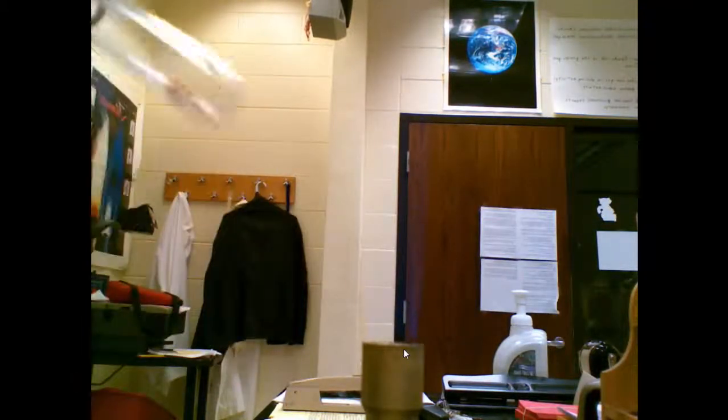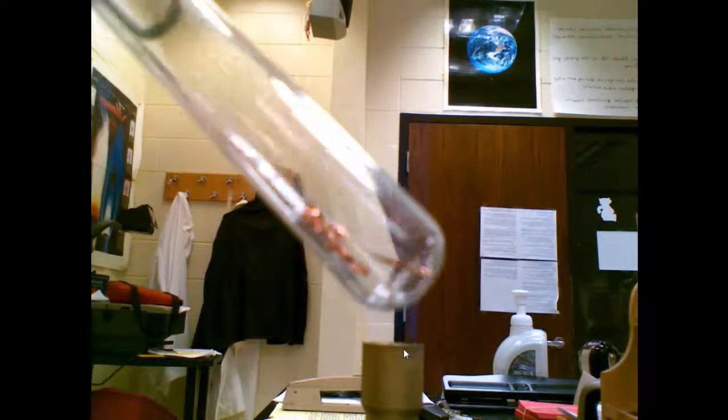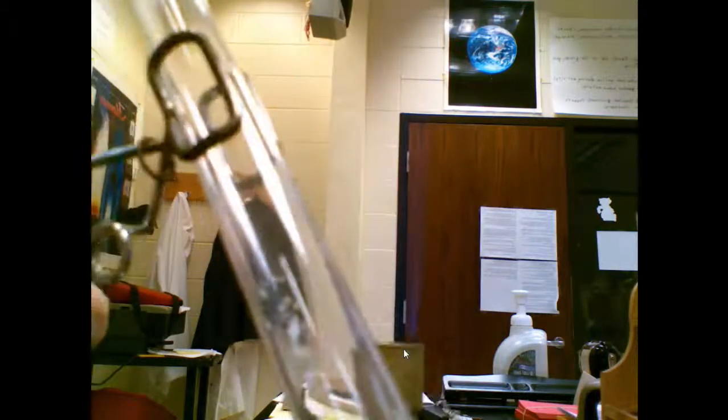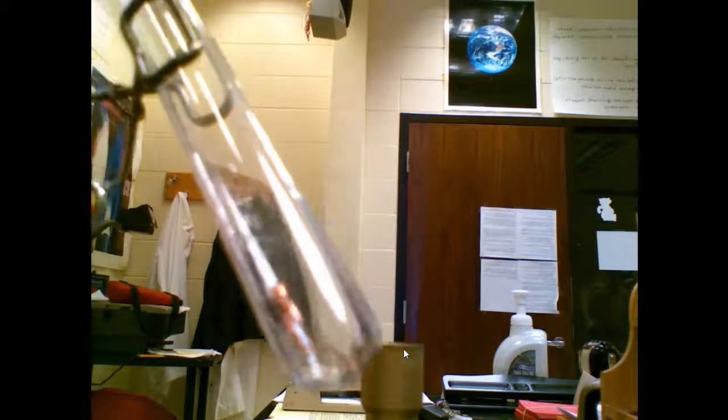I have the 12 different crystals set up in test tubes. Inside these test tubes it's just the crystal, so in this case it's a ribbon looking sample. I do not put any water in this because I'm just using the test tube as a container to hold that crystal in order to try to melt it.